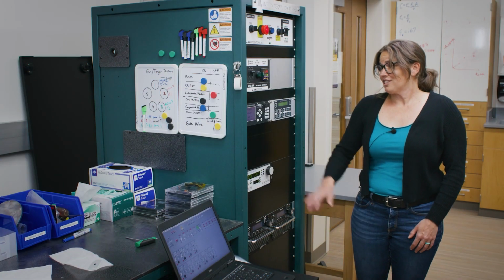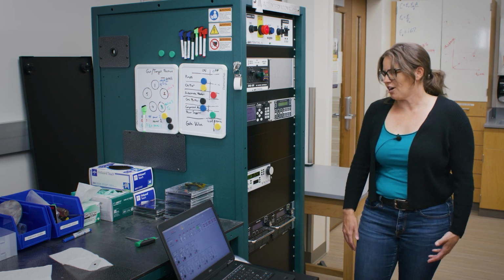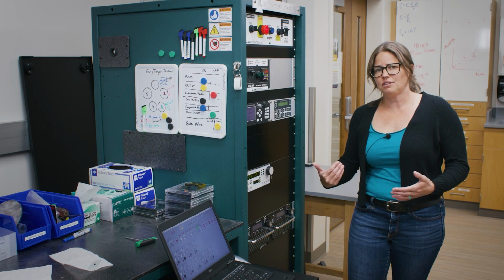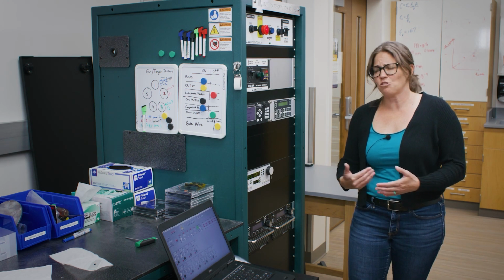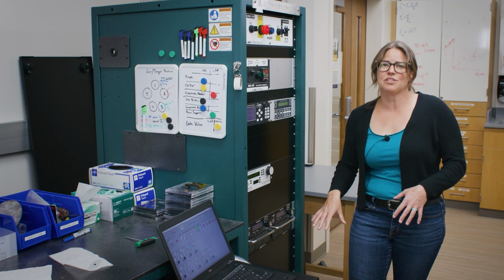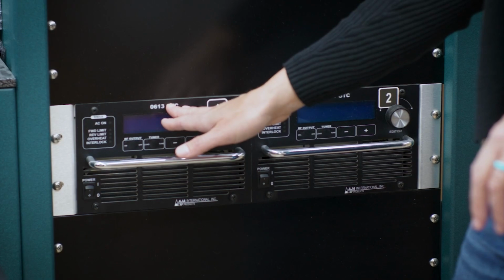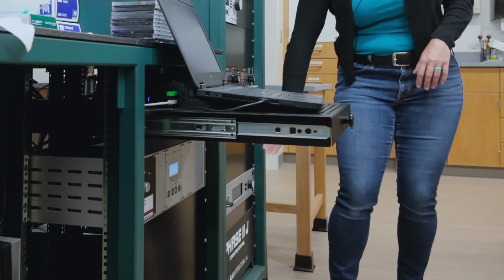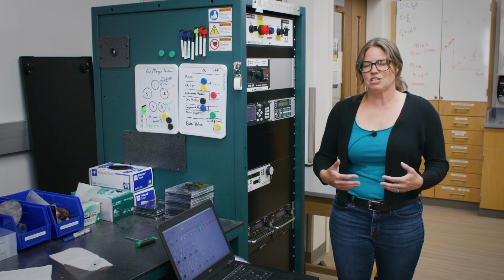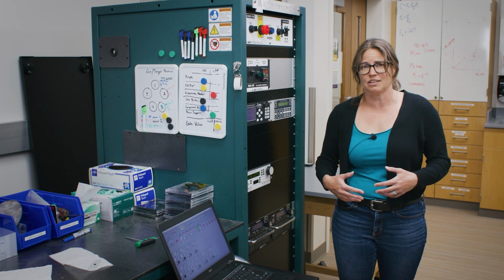Okay, so now we're down at the right pressure. We've evacuated enough air from our vacuum system. I've turned on an argon bottle so that way when we put gas back in, it'll be inert. And we have 2 sets of power supplies that we use to potentially run this tool. We have RF power supplies here, 1 and 2, and a DC power supply here. Depending upon the type of material you want to deposit will determine which supply you're going to be using.